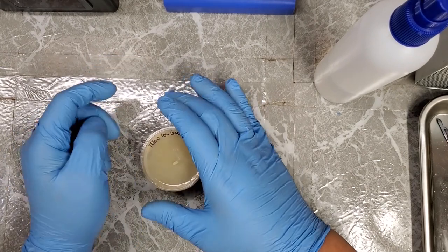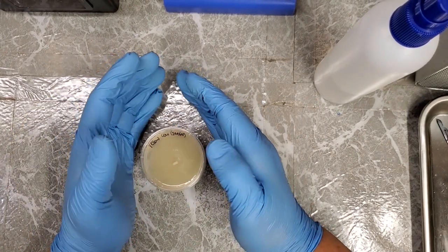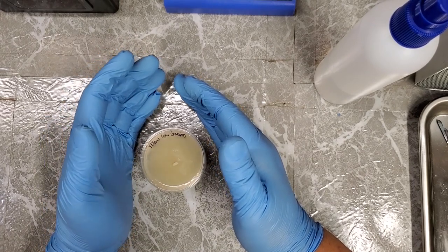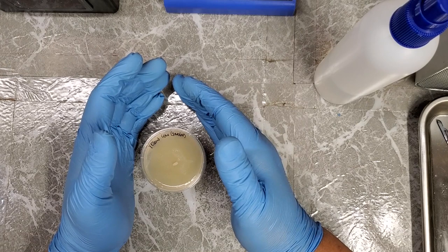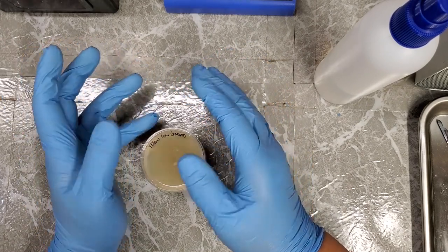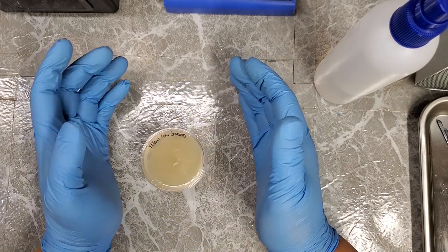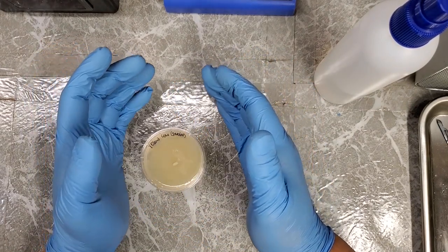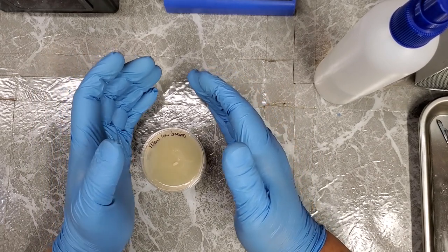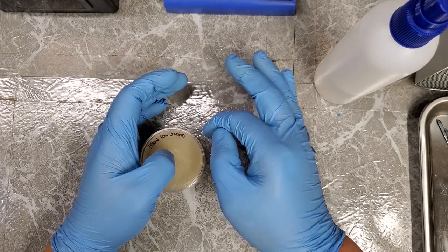Now it's just a matter of, like I said, put these in the incubator or wherever you're going to use to let them colonize. If you don't have an incubator, that's fine, but I do highly recommend at least putting them in maybe a Tupperware container that's vented so that there's not a whole lot of air movement around, because even though these are covered by design, if you have a fan on or something, or even if somebody walks by fast enough to have a decent amount of air movement, it can still get up underneath these lids just enough to contaminate the edges.